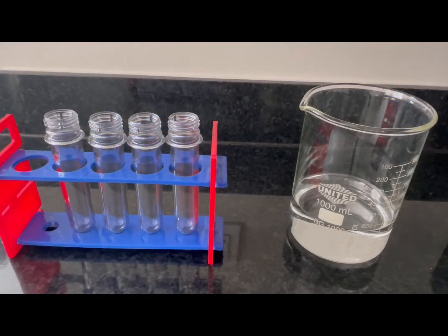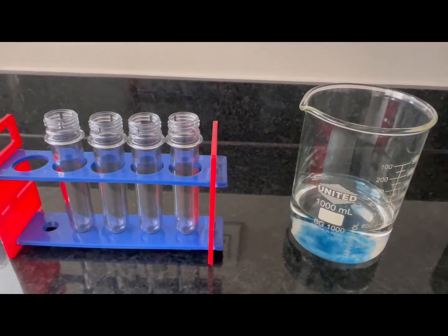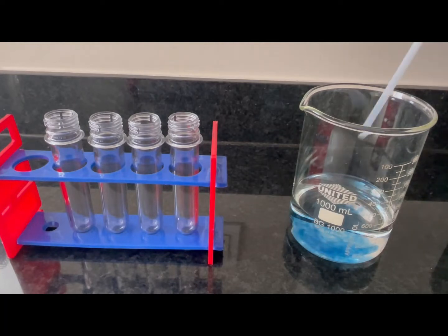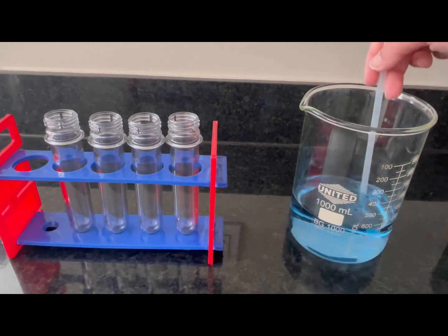Your first step is to add a couple of dropperfuls of the bromothymol blue into the distilled water, and then we're going to stir it with the straw.